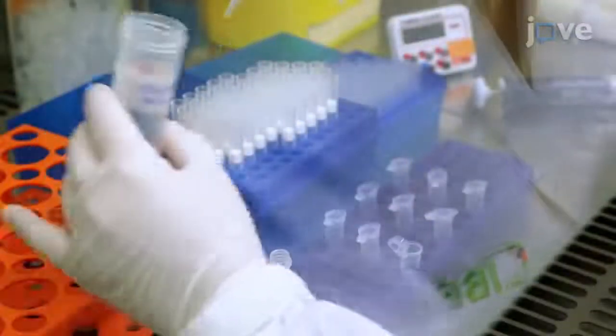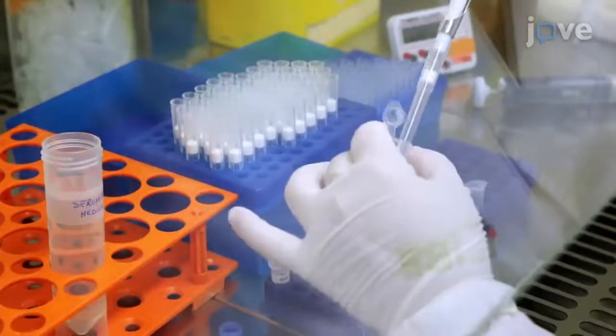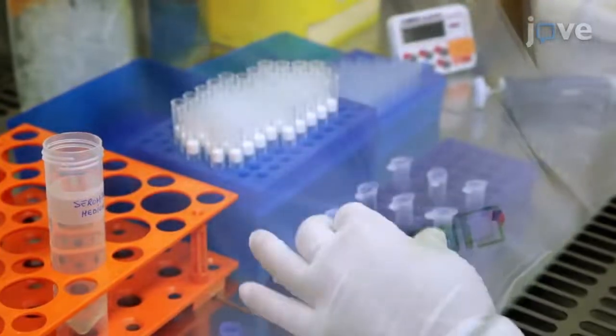To prepare a liposomal tube, add 240 µL of serum-free medium and 10 µL of liposomal transfection reagent and incubate at room temperature for 5 minutes.